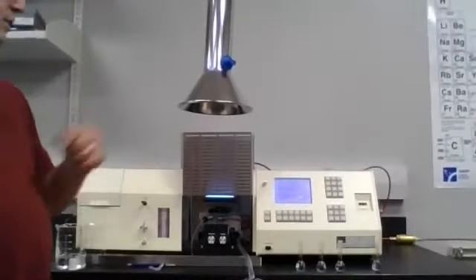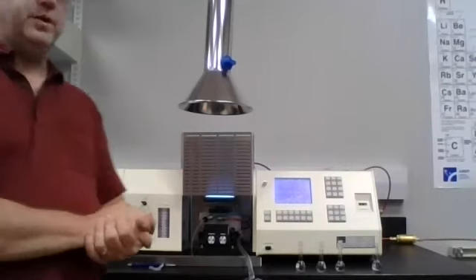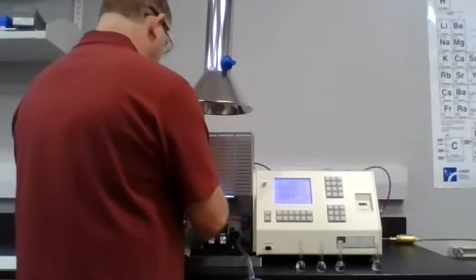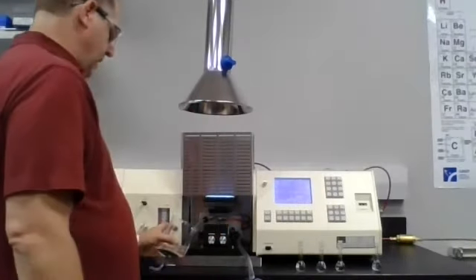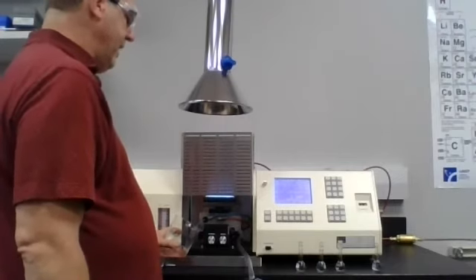Okay, I have tried to play with this a little bit and get where you could actually read the numbers and see what's going on, but instead I'm going to read these to you. The first thing we're going to do is calibrate this with just some of the 0.1 molar nitric acid, and we have that. Now I could do a couple things here.